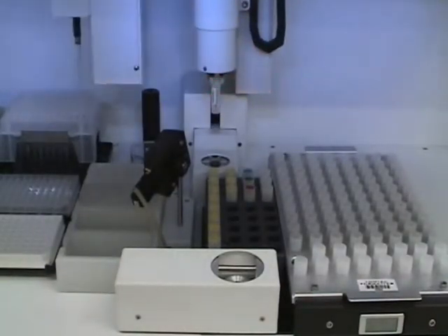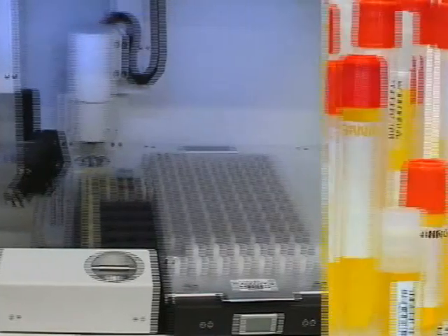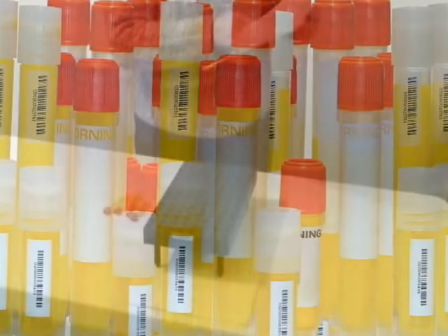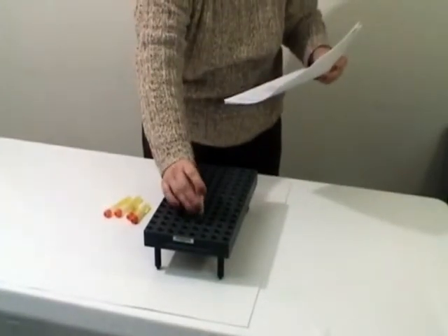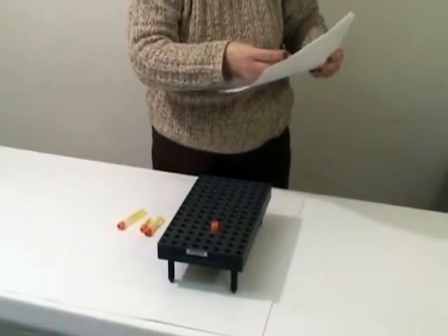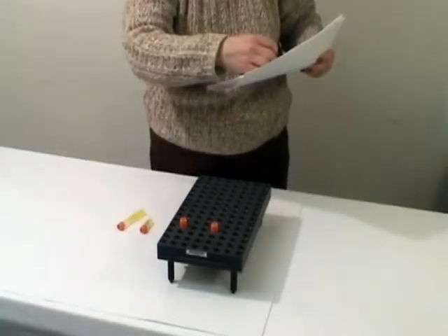In many cases, the unknowns will come into the program with barcoded vials since they must be tracked from a source external to the laboratory. However, the standard and QC samples are usually made locally and they may not have barcode identifiers. The formatter can run the standards, QC, and blank by position and the unknowns by barcode. However, as stated previously, if running by position, it is the obligation of the operator to place each vial in its designated position created by the worklist. For this example, click Run by Position.